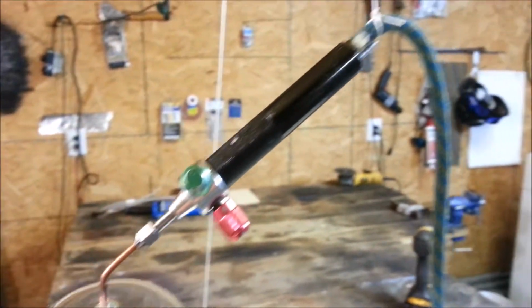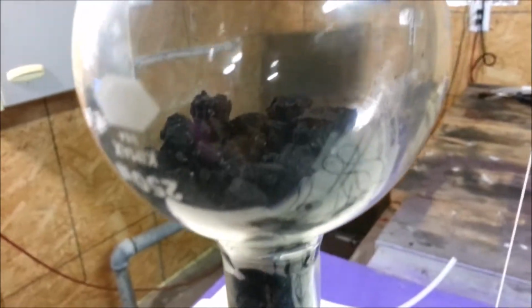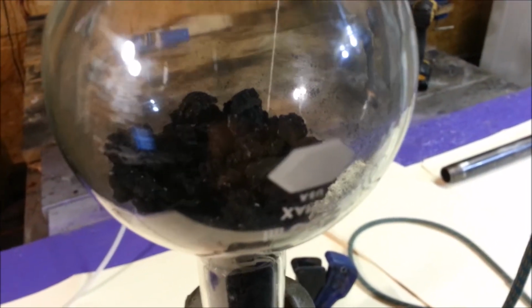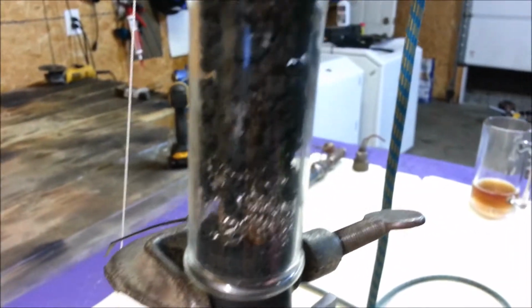And then I just got a hydrogen torch that I just rigged up here to make this a quick and simple experiment. And we're going to revisit that test. I don't have any activated carbon, so all I have is charcoal. So we're going to try charcoal first. I'm hoping to get a red hot area going here, and then all the gases will hopefully be forced through the red hot zone, and we'll get us a carbon monoxide flame shooting out this part here.